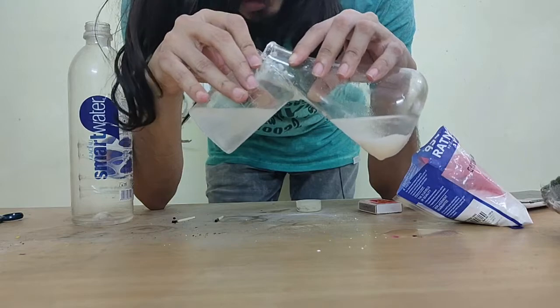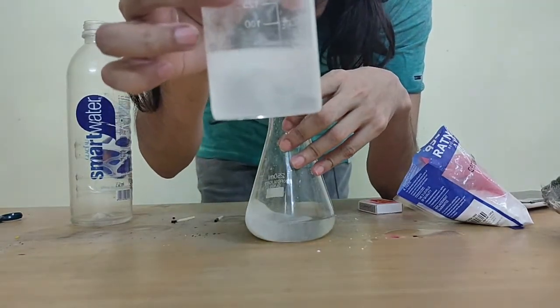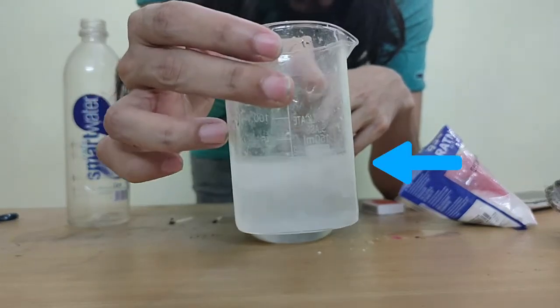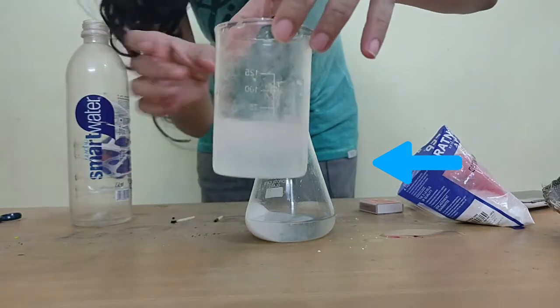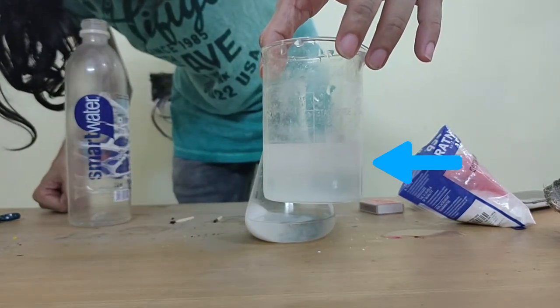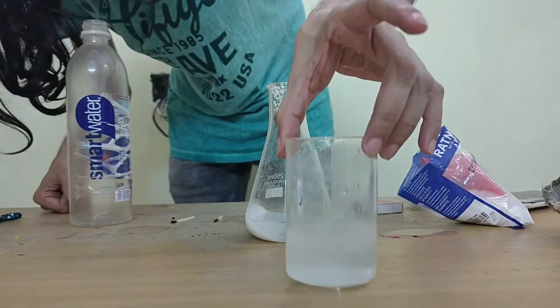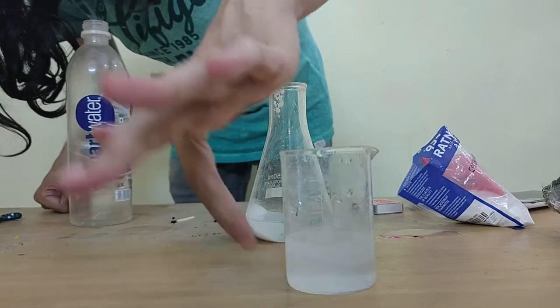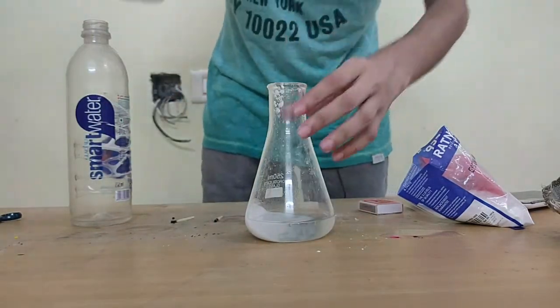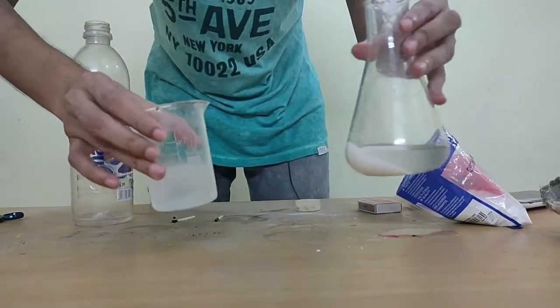I've been dripping this over here, but if you see here, a wispy white something is formed, right? Yes, yesterday we weren't able to do it, but here it is. Now it was pretty much a clear liquid, but now it's a little smoky over here on the top, if you see, right? Yes, we have successfully done the test that we wanted, and that is for carbon dioxide gas.